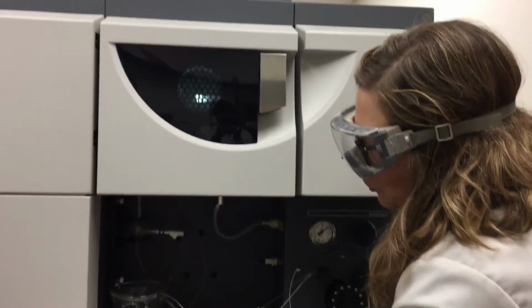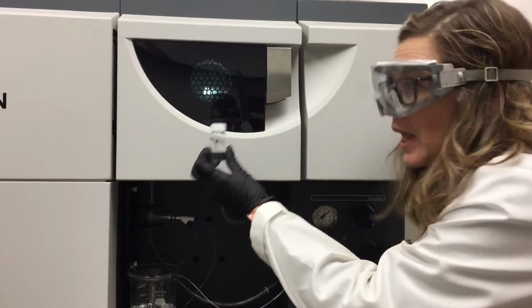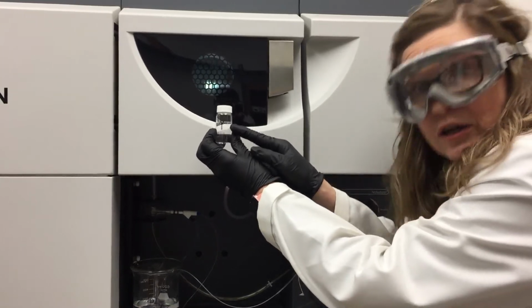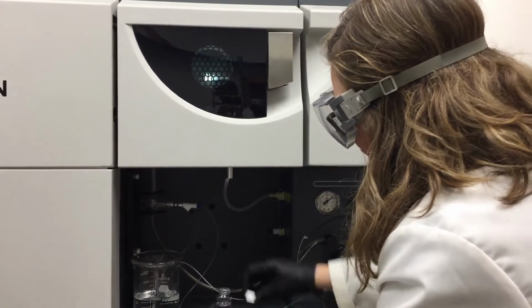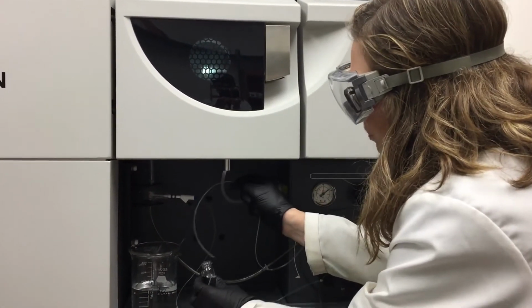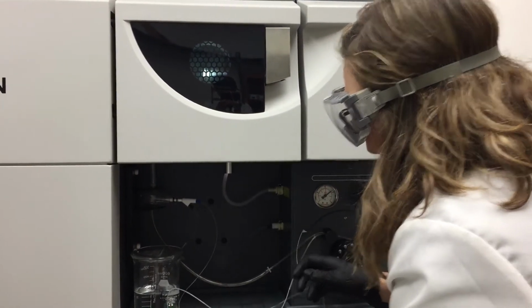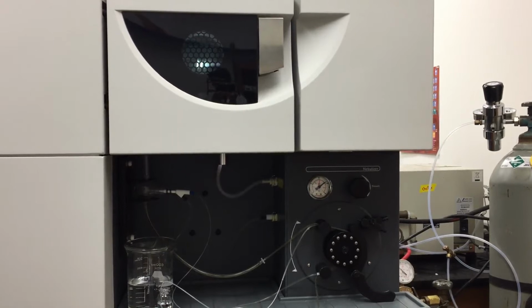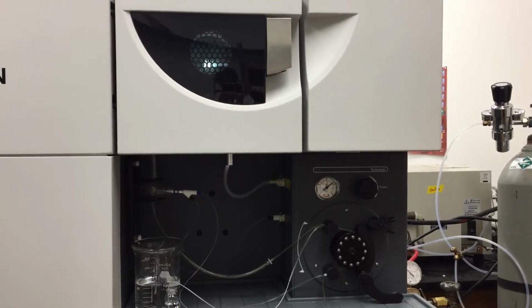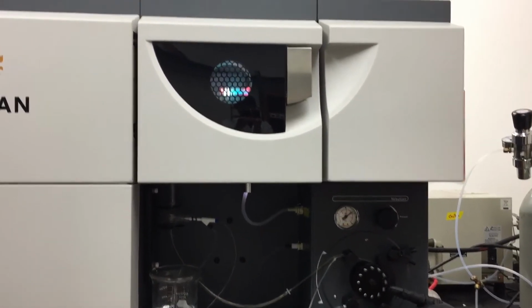So just as a demonstration, I'm going to introduce 10,000 parts per million of yttrium, and we're going to watch what happens when this concentrated yttrium solution reaches that plasma. So just putting the tubing into the yttrium, and maybe I'll increase the pump speed so we don't have to wait so long. Can you see how the pump is spinning faster?